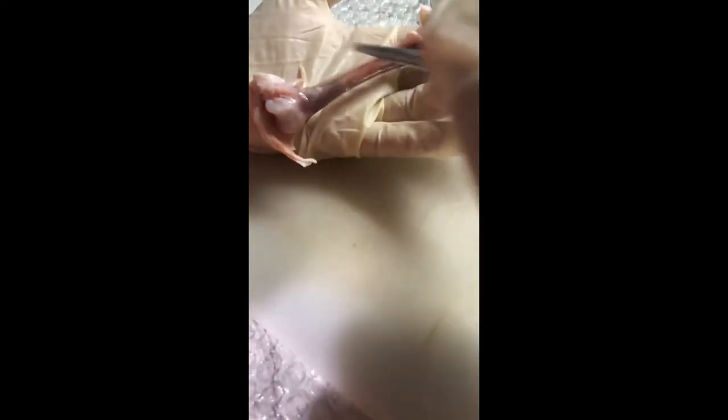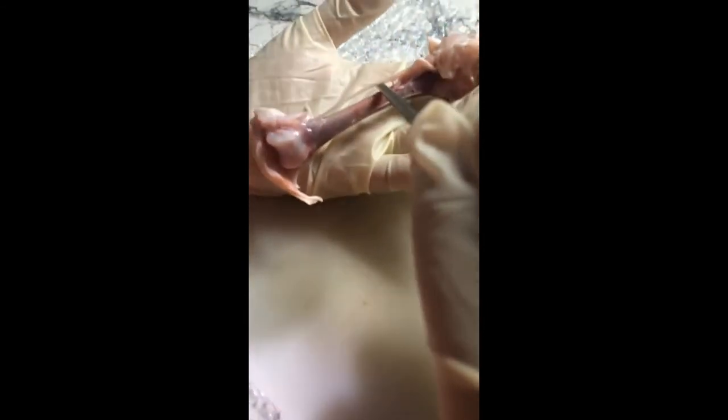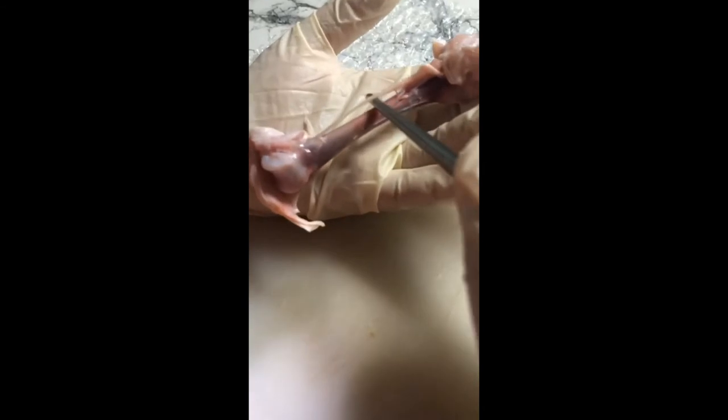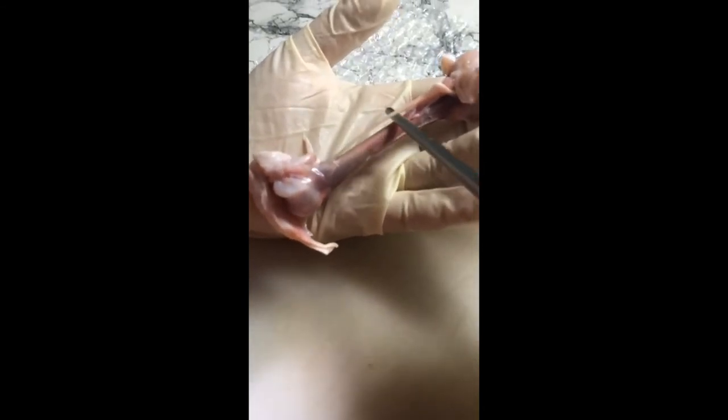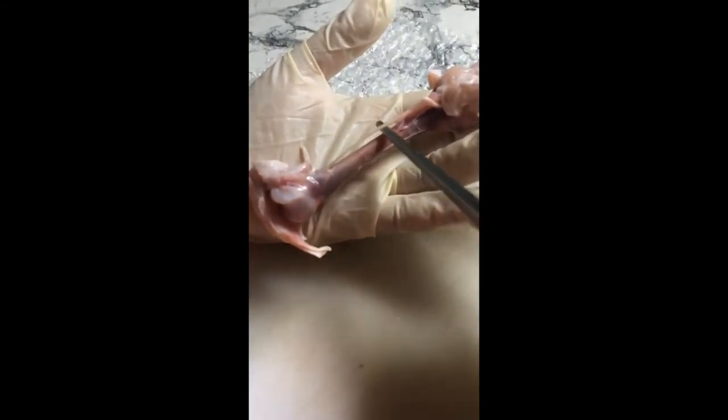These are similar to the tibia and the fibula found in our leg, except in the chicken leg the fibula is so tiny we can barely see it.